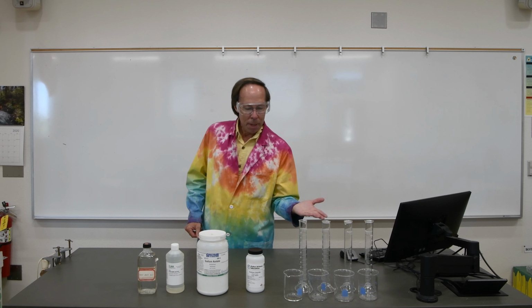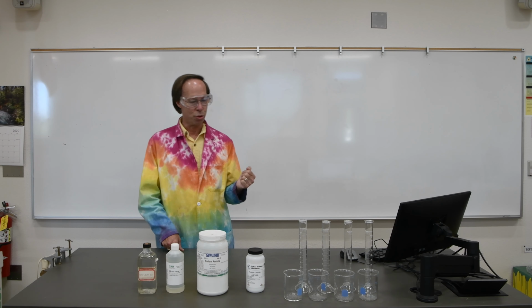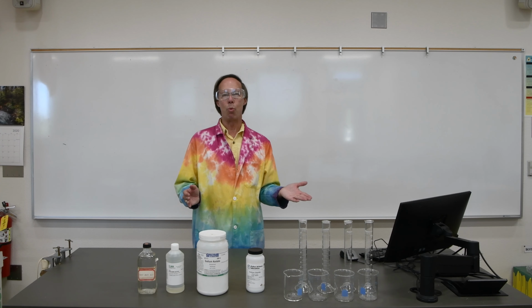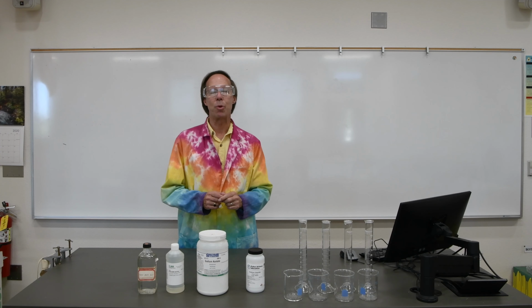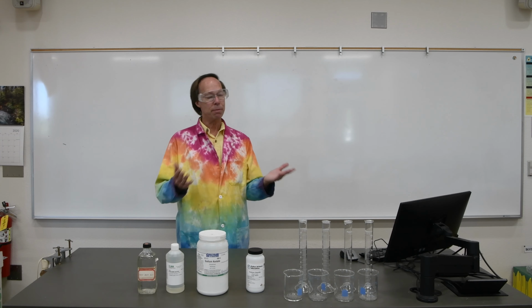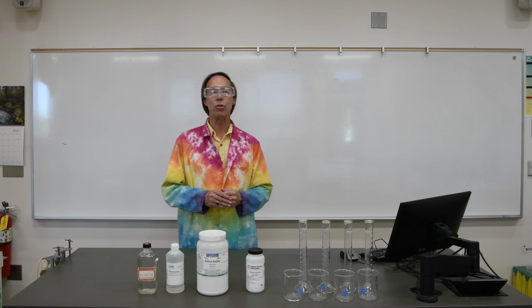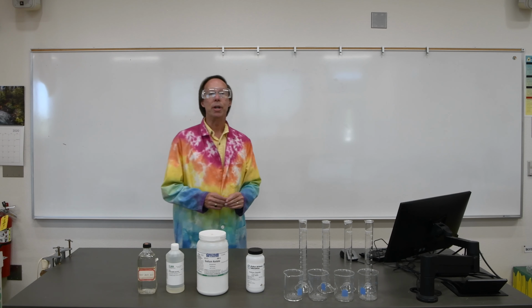The easiest way to make them is to make a total of 100 grams approximately of each solution. So we could, for example, take 5 grams of sodium chloride, place that in a beaker, add 95 grams of water, we have a 5% solution. Our second one would be 10 grams of sodium chloride and 90 grams of water, and then 15 and 85, and finally 20 and 80. So that will give us approximately a 5, 10, 15, and 20% solution of the sodium chloride. We'll repeat that then for the other 3 compounds.